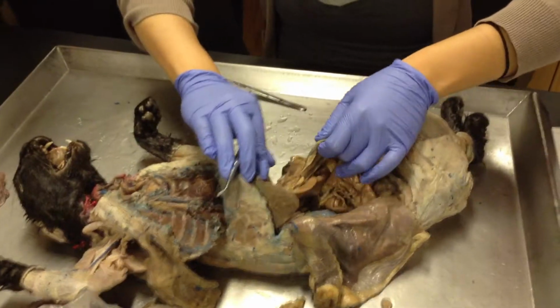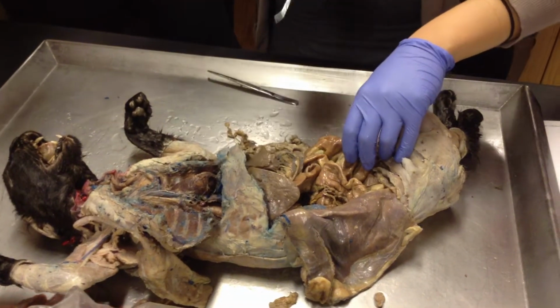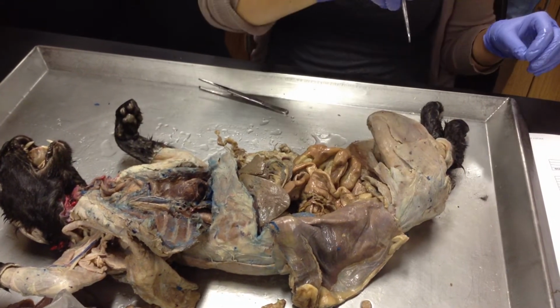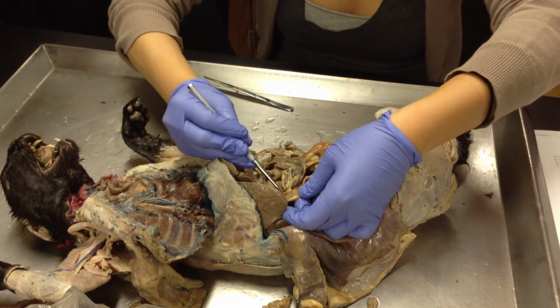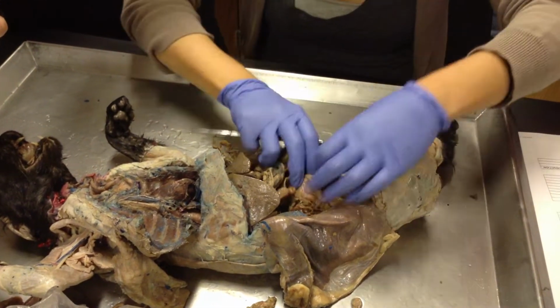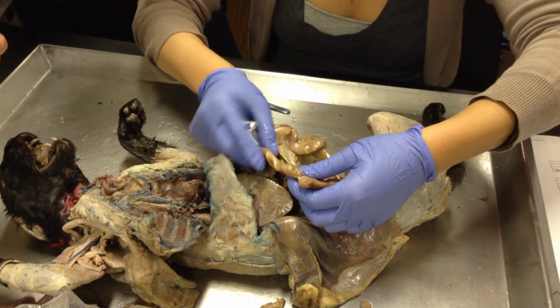The duodenum. And remember that the small intestines, I can ask you a small intestines question if I pin it at the very beginning of it or the very end of it or smack in the middle, right? That's what I was saying. So right next to the stomach, if I pin the small intestines just next to it, is the what? The duodenum, good. Smack in the middle probably is the jejunum, and then right next to the large intestine, this is the ileum right here.